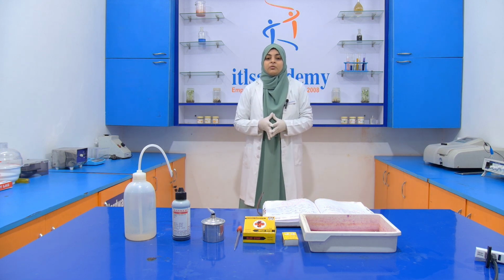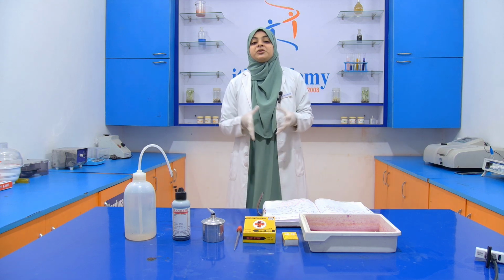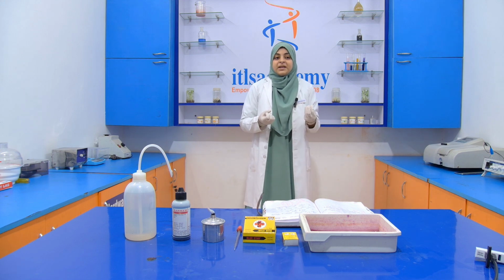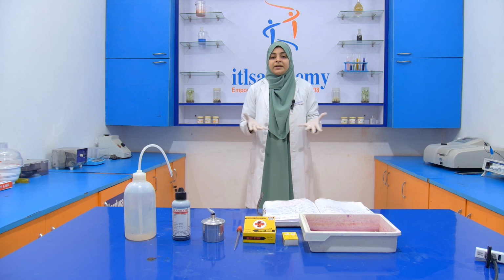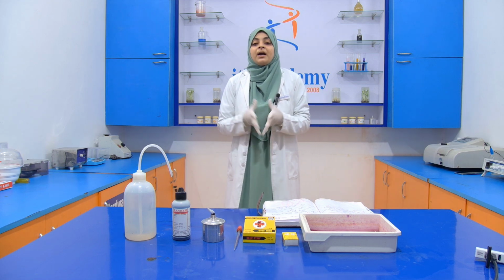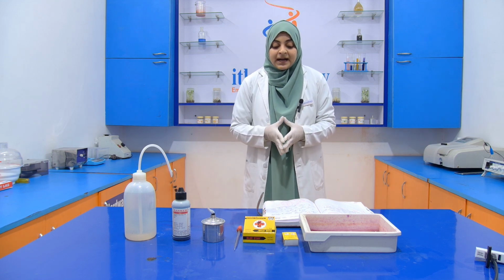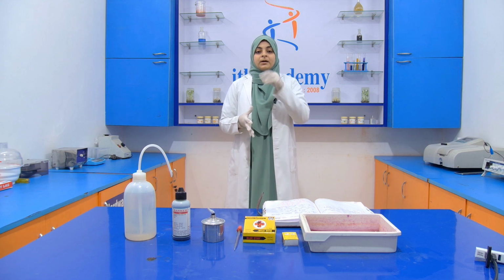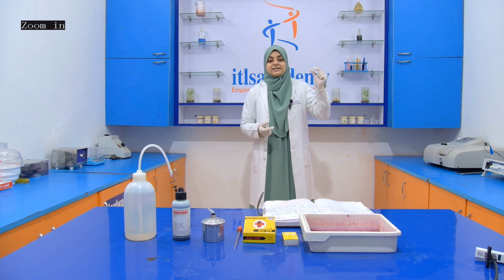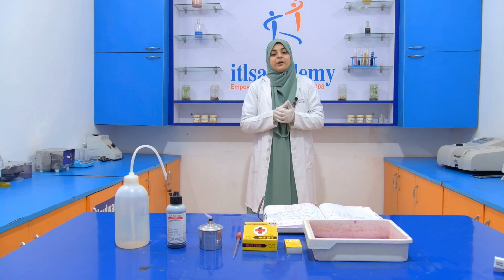We all know that microorganisms are colorless, which means that we cannot see them without any stain. If something is colorless, then how do we see it? That's why staining is used, which gives a color to the microorganisms and also highlights the cells. These stains highlight the cells, so the cells are visualized when we see them under the microscope.